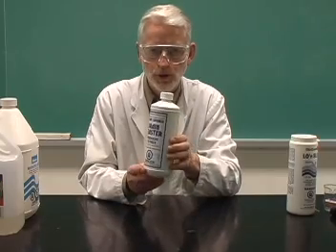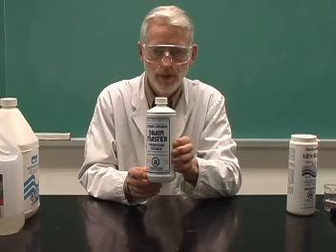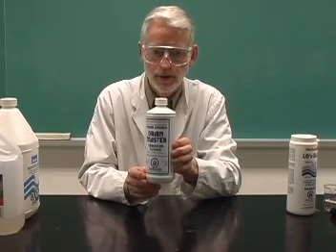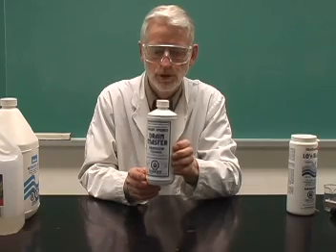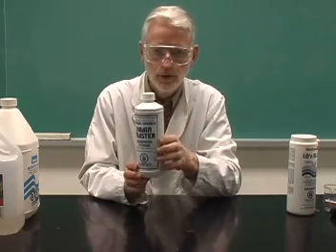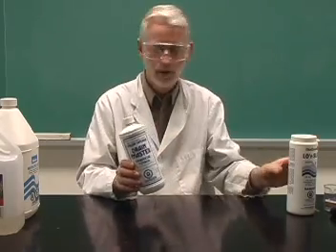Even though it's a household chemical, it is still extremely corrosive and can attack your skin and clothing, so you want to make sure you don't work with this carelessly. And that goes for, of course, any of the reagents that you use.